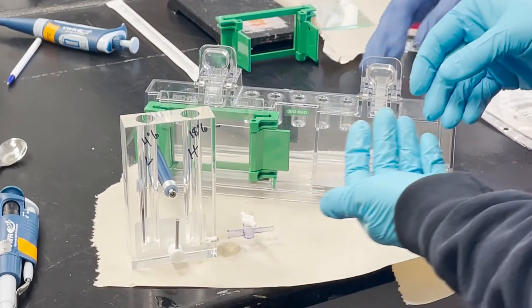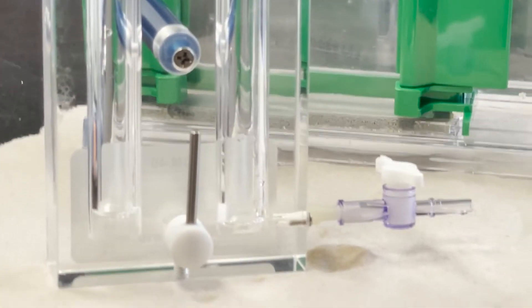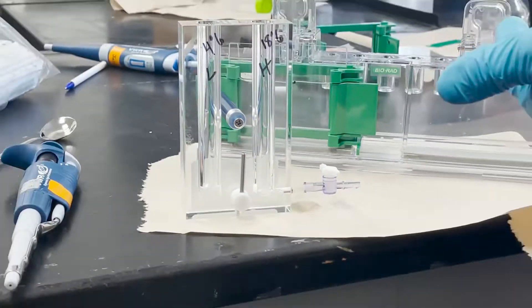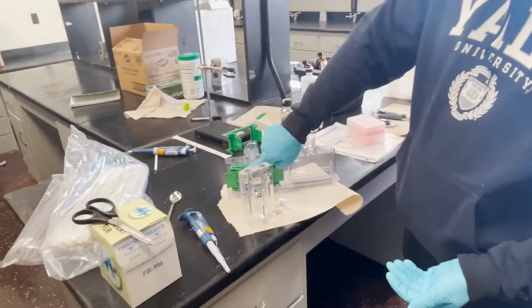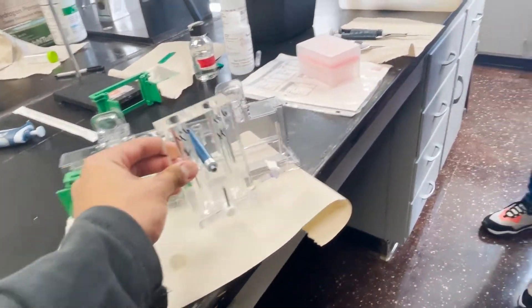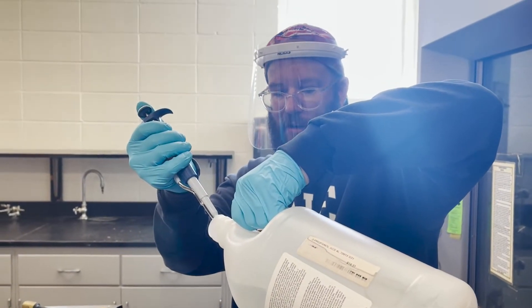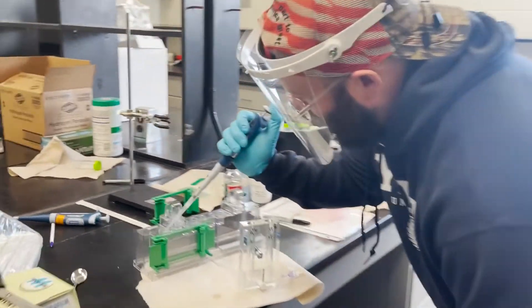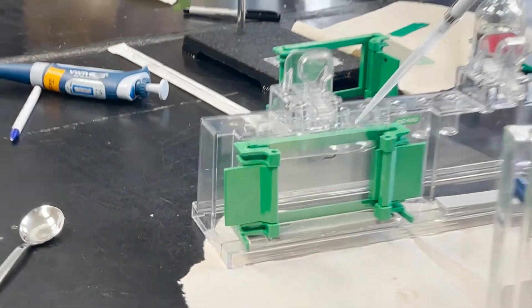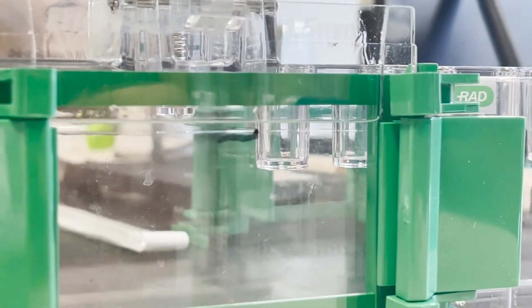What's going to stop it from the higher load mixing and just being the average density? Density, plus the glycerol adds a little bit of resistance to the mixing. Now, notice there are a few bubbles — normally what you do is take some isopropyl alcohol and put it on top using a Pasteur pipette. You put a layer of isopropyl alcohol and the layers will separate. You can see the two layers — that's how you get a perfect flat transition.